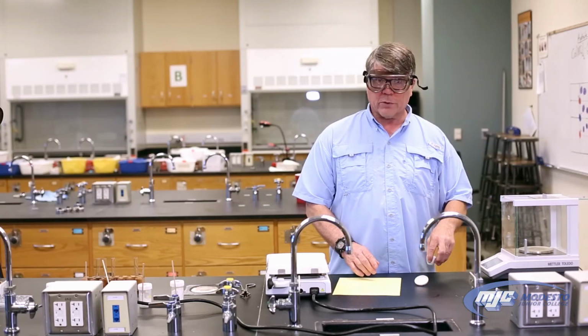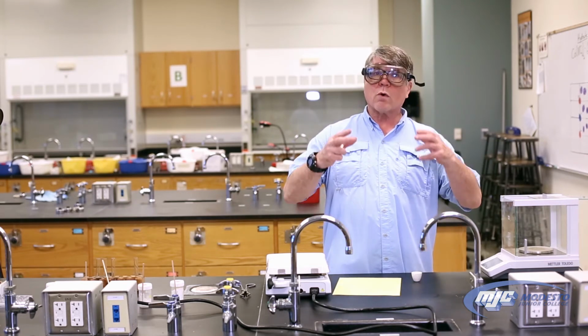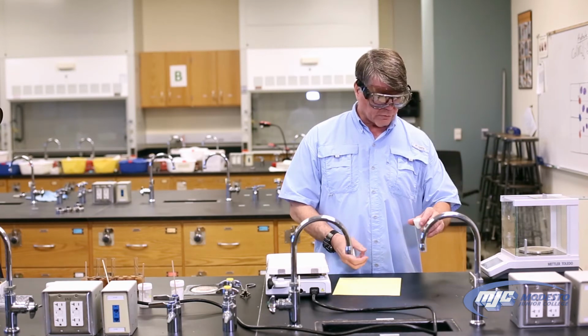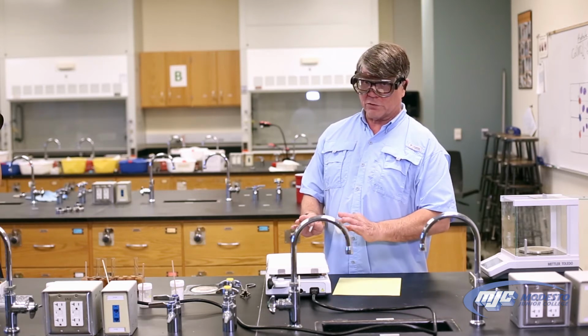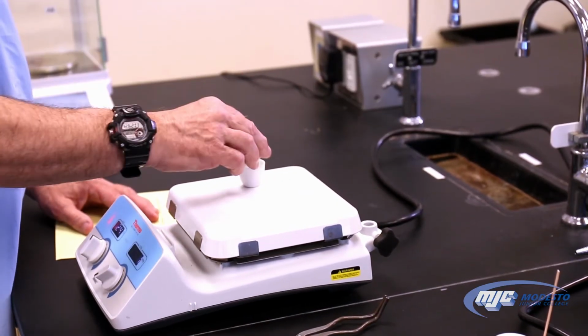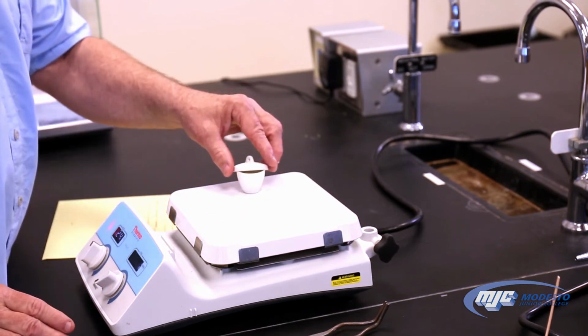Now what we're going to do is we're going to start heating it up. Remember, our goal in heating it up is to drive those water molecules out of those empty spaces in the crystal lattice. So what we do is we take this, put it on a hot plate. I have this hot plate turned on about halfway. It's for gentle heating. So what we're going to do is put this on, take the lid, and we're going to crack it just a little bit. Leave a little opening right there.